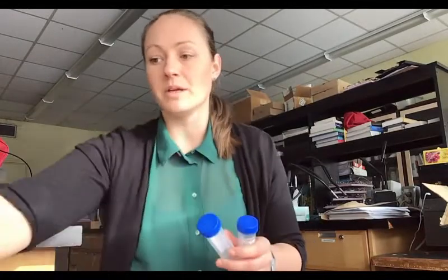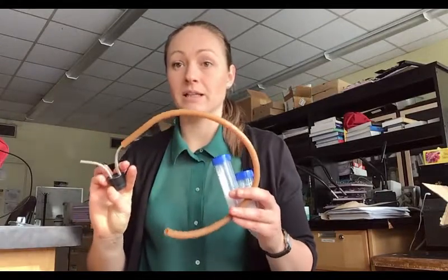This label will correspond to one of these boxes here. You will have a couple of collection tubes depending on what type of sampling you're doing, as well as your pooter. This is the device you use to actually collect the mosquitoes. I'll show you how this works.